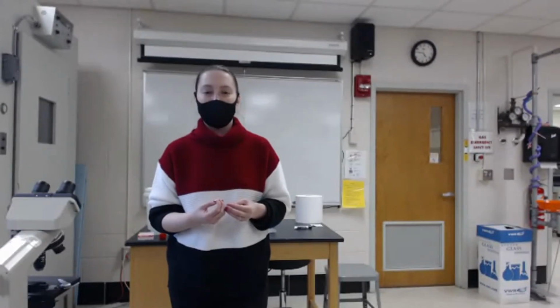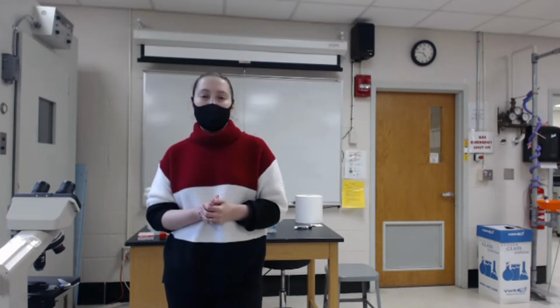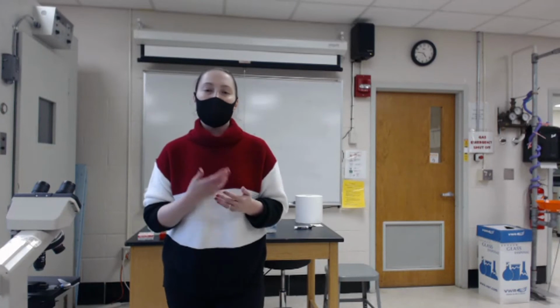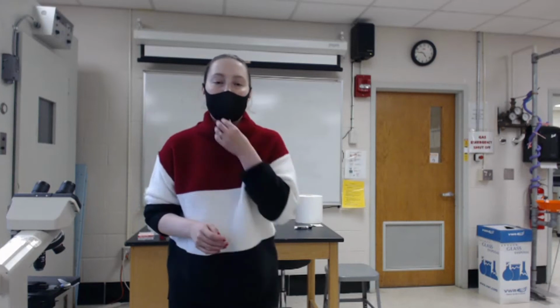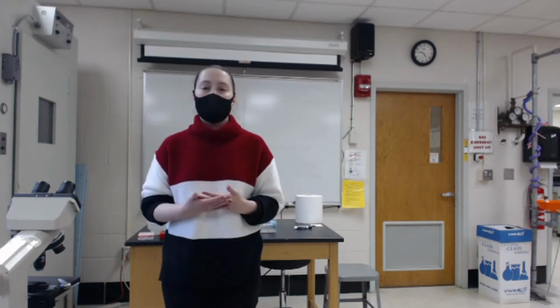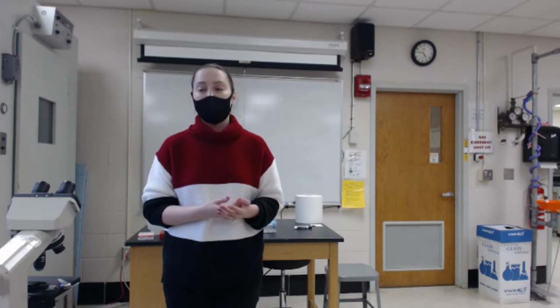Today we're going to go over microscopy, and specifically we're going to learn how to use the oil immersion lens. To illustrate its use, we're going to use Carolina's bacterial type slides, and I'll show you images of the different types of bacteria that we will be able to view under the oil immersion lens. So my first question is, why do we use an oil immersion lens in microscopy?